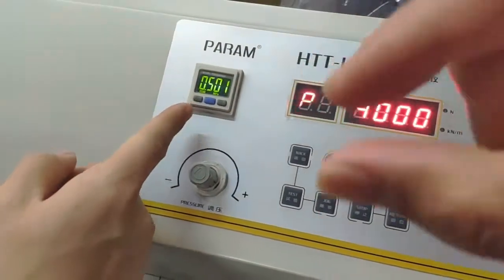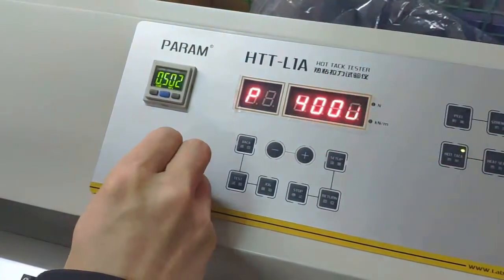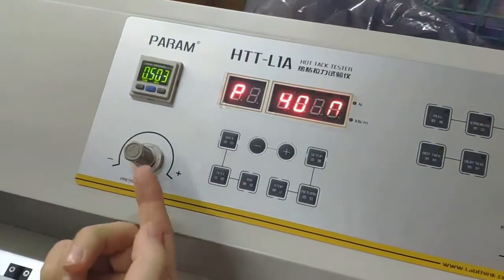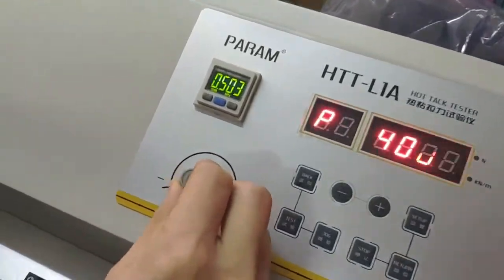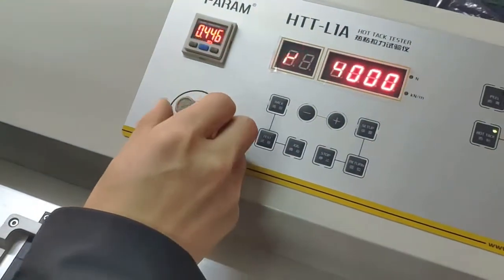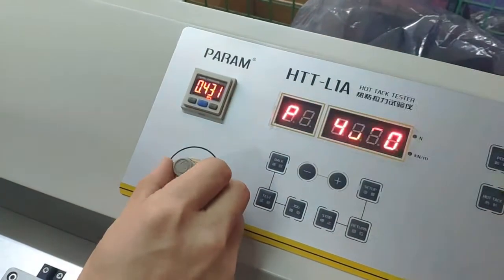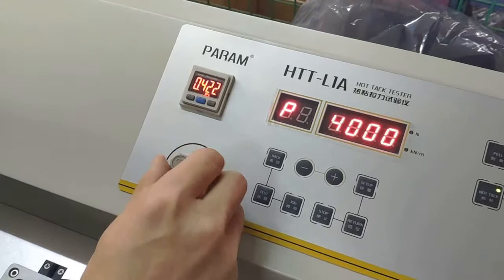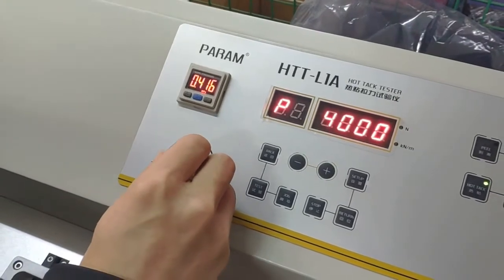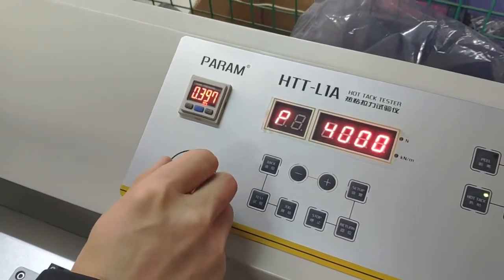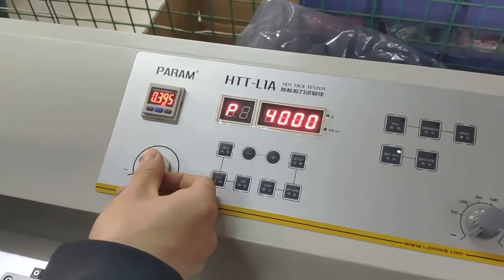Press the test button and the jaw will meet up. You can adjust by this knob to the required pressure. This is in megapascals. Now it is 0.4 megapascals, like 400 kilopascals.